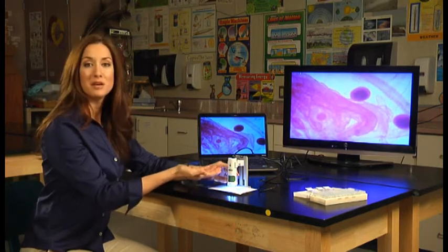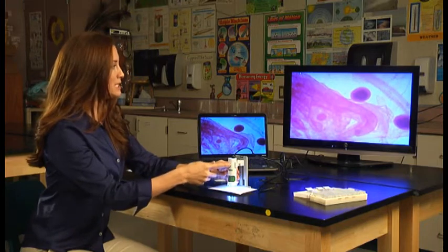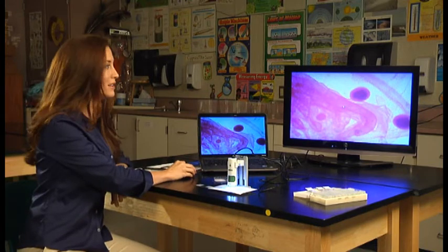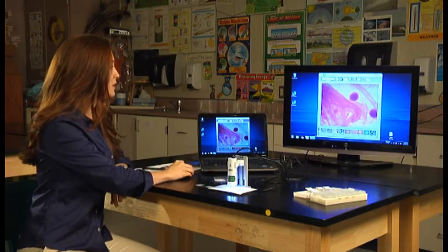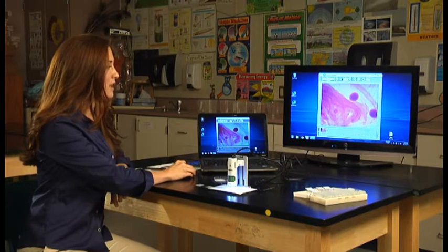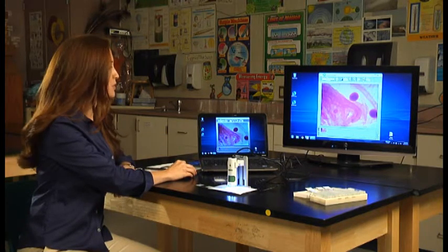And we also have the ability to take pictures. So I'm going to go ahead and take one of this, and then to view the pictures, all you have to do is double click to exit full screen mode. You can scroll through all of the pictures that you've taken down at the bottom, and the last photo you took will be the last picture on here.